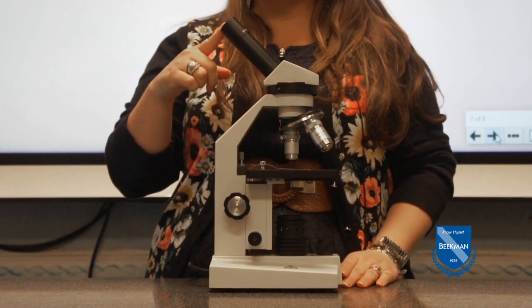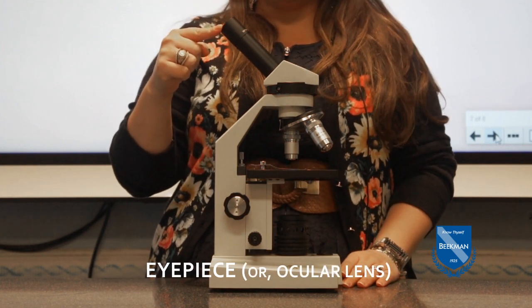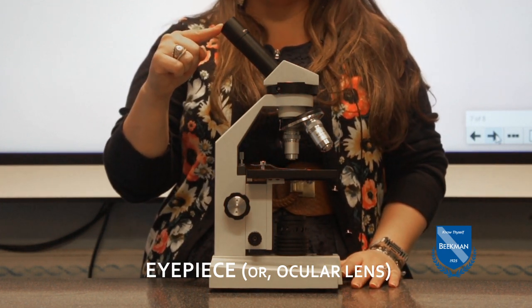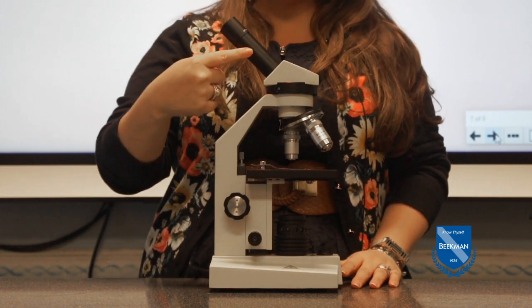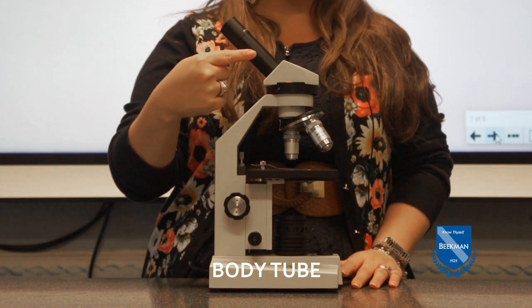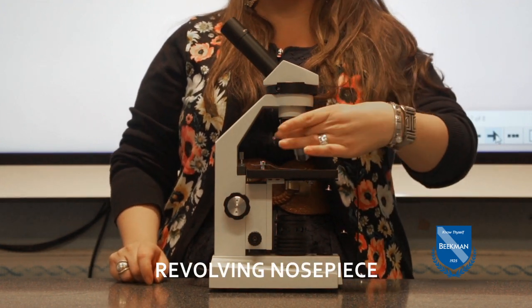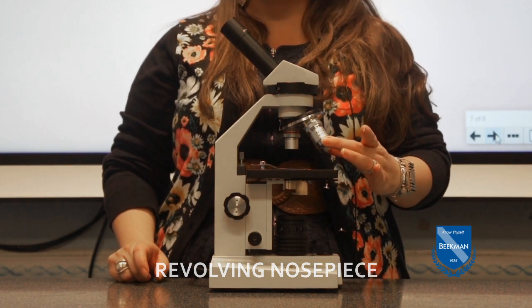Coming back up to the top, this is called your eyepiece. The eyepiece is also known as the ocular lens, and it has a lens that magnifies 10 times. Keep that in mind. We'll be talking about it again when we reach our objective lenses. So again, this is the eyepiece or ocular lens. This is the body tube area of your microscope, and it's where the magic happens, where the lights and the lenses do their work magnifying your object. This piece is called the revolving nose piece. It rotates to allow you to set different objectives into place.